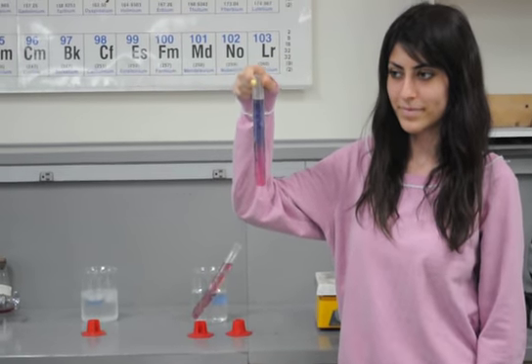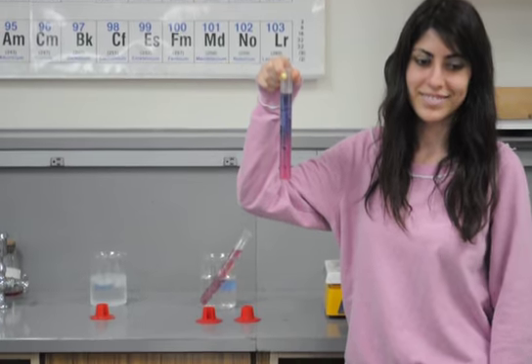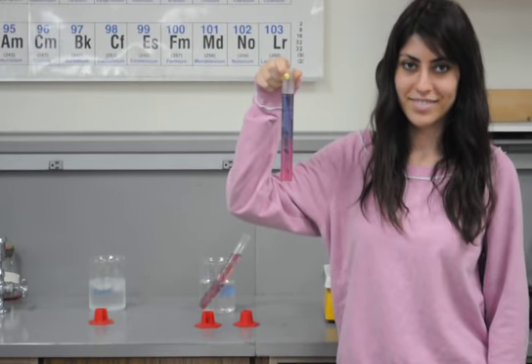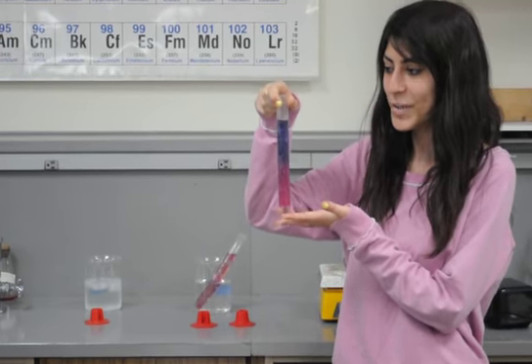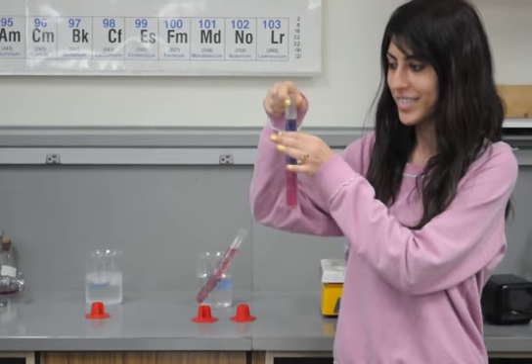So we can see that that has a layering effect. Now, Shake, would you please touch the bottom of that tube and tell me what you feel? And what do you feel at the top? Hot.